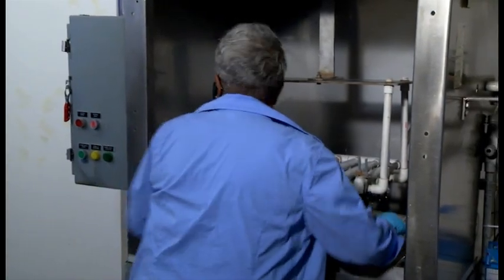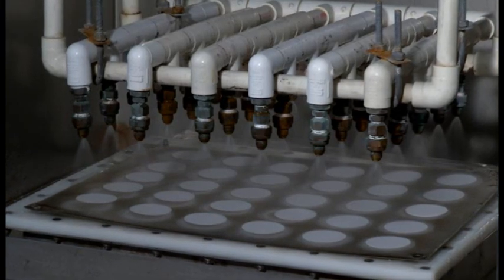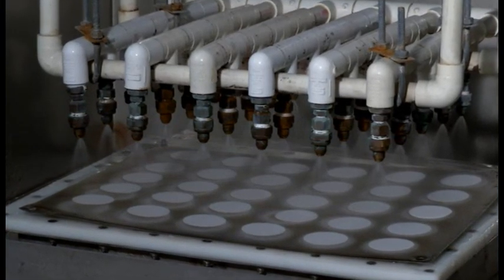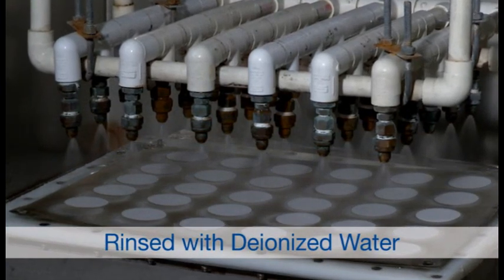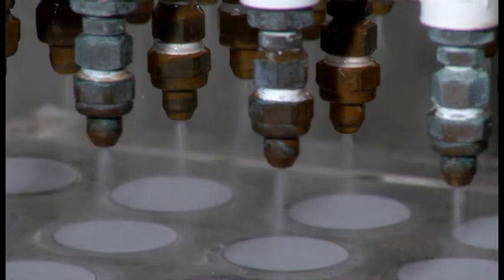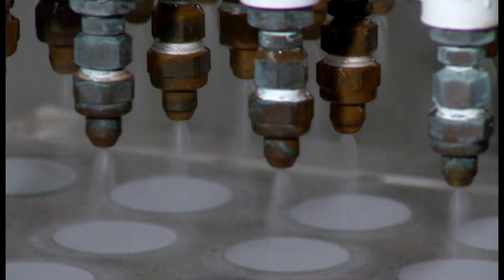Filters are transferred to a washing station to remove items within the filter from the manufacturing process. Just as the method specifies, we wash and vacuum with three rounds of a minimum of 20 milliliters each time. The vacuum continues to ensure all particles and a vast amount of the moisture has been removed.